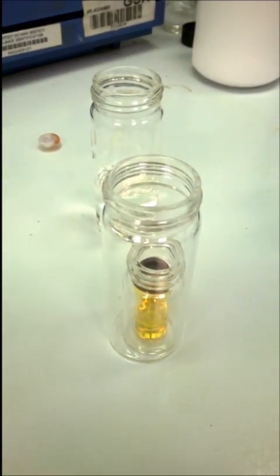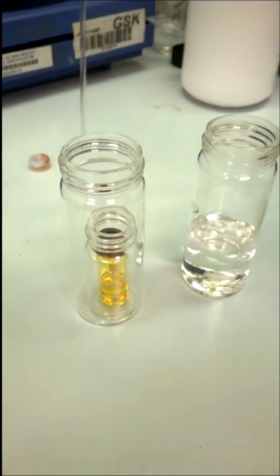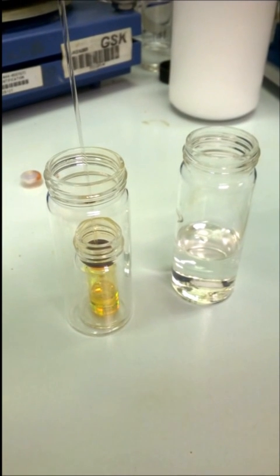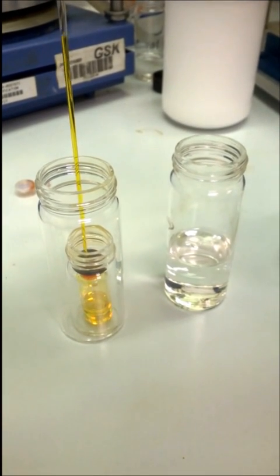Right, here's some fun stuff I have the unenviable task of getting rid of. So, let's carefully quench this. Reacts very badly to air, as you can tell. Just blowing a little bit of air into it is not good. Get a couple of drops in.